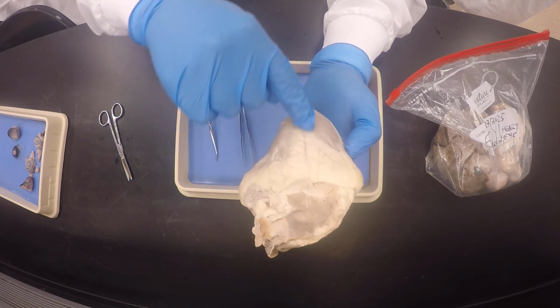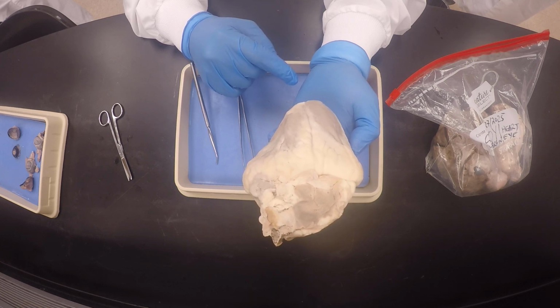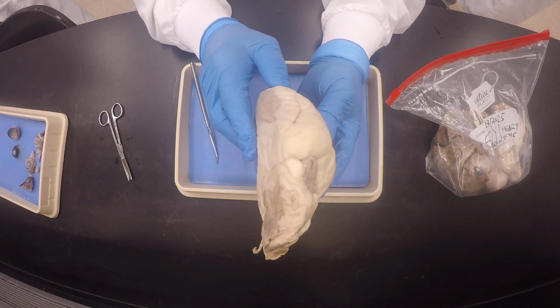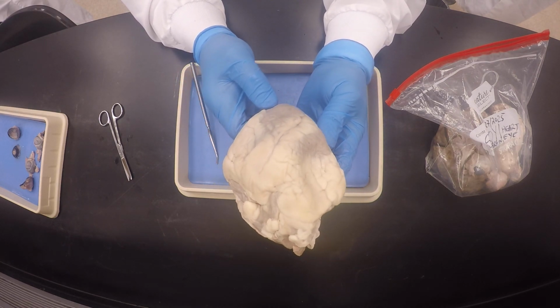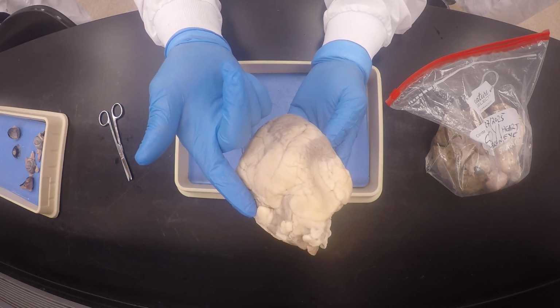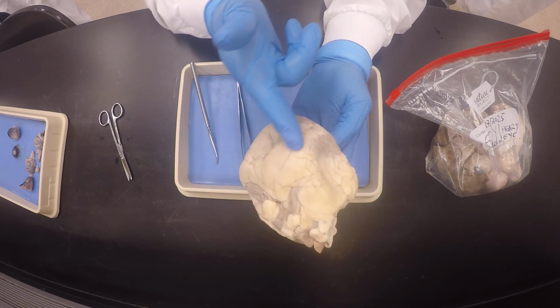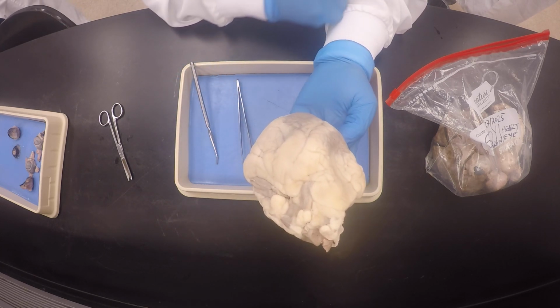Okay, do you see how this is almost vertical? So you know it's the posterior side, correct? Okay, my good friends, I keep turning and looking and looking. Voila! Do you see this one sloping from the top left to the bottom right? So this is the anterior interventricular sulcus for sure.